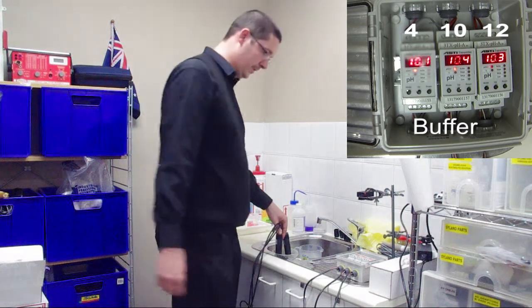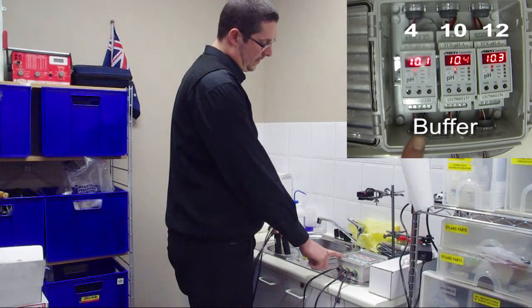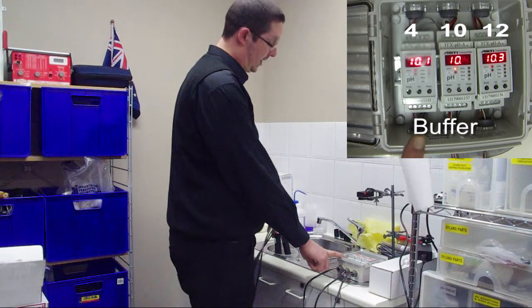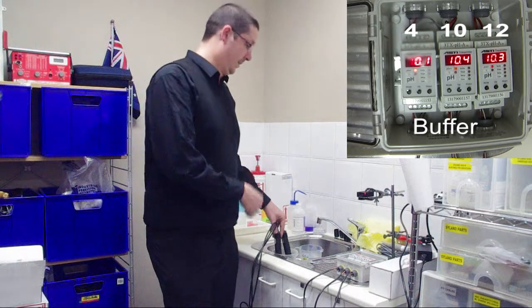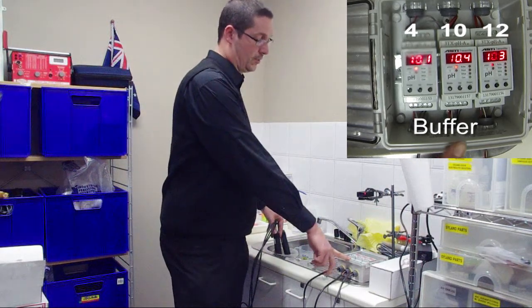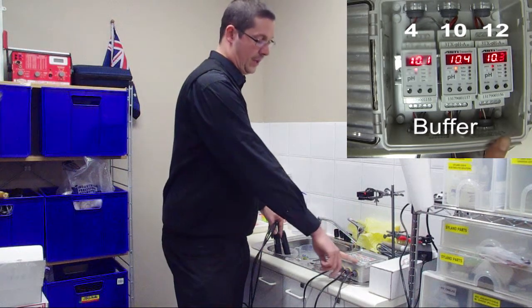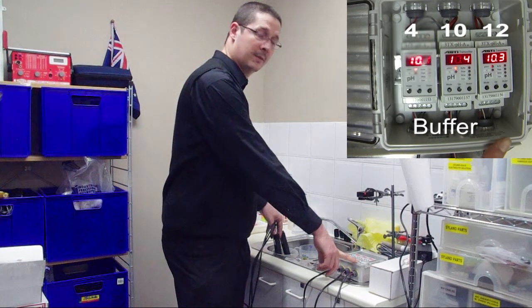Now, if we look at our values, the transmitter calibrated to pH 4 is giving us a 10.1 on this solution. I don't know the pH of this solution, it's just some dishwasher fluid mixed up with some water. Now the one in the middle, calibrated to a pH 10 buffer, is giving us pH 10.4. And the one on the end, calibrated to pH 12, is giving us pH 10.3.